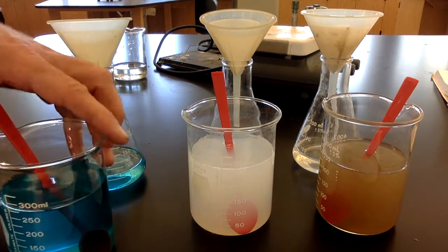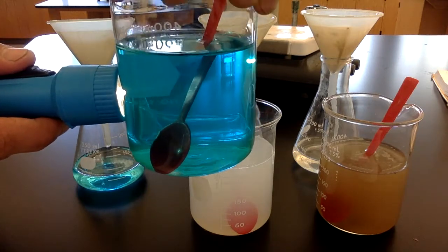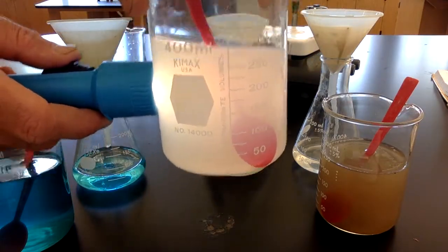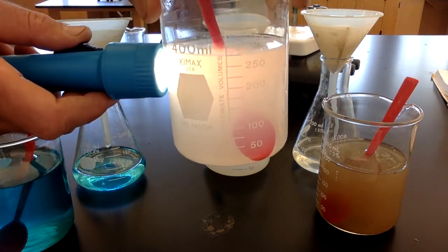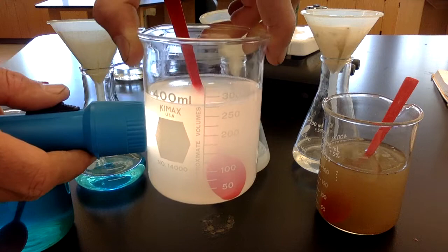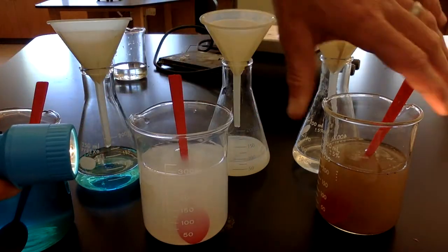So I've got a flashlight and I'm shining it through beaker A with this blue liquid in it, and you can't really see it, the light just passes through it. I'm going to do the same thing in beaker B with the white liquid in it, and what you should be able to see here is that the beam of light is actually able to be seen in that solution. So you can actually see the beam of light as it passes through that white solution, because there's little particles and the light is bouncing off of it. So you can actually see the beam of light when it goes through that one.